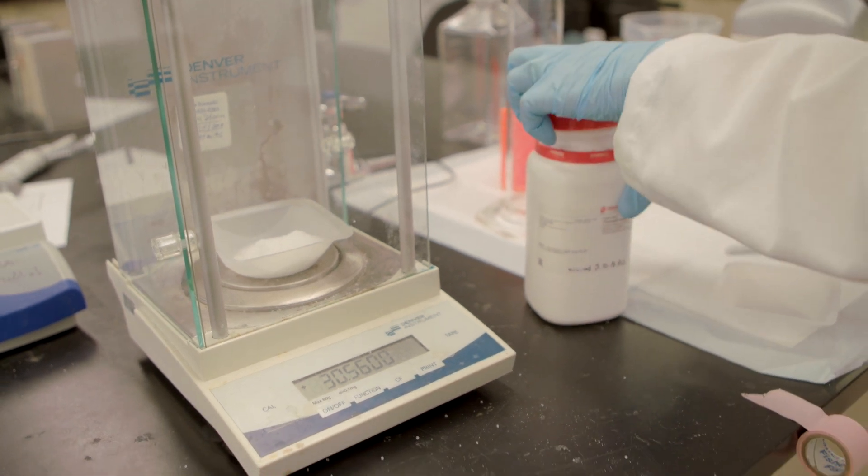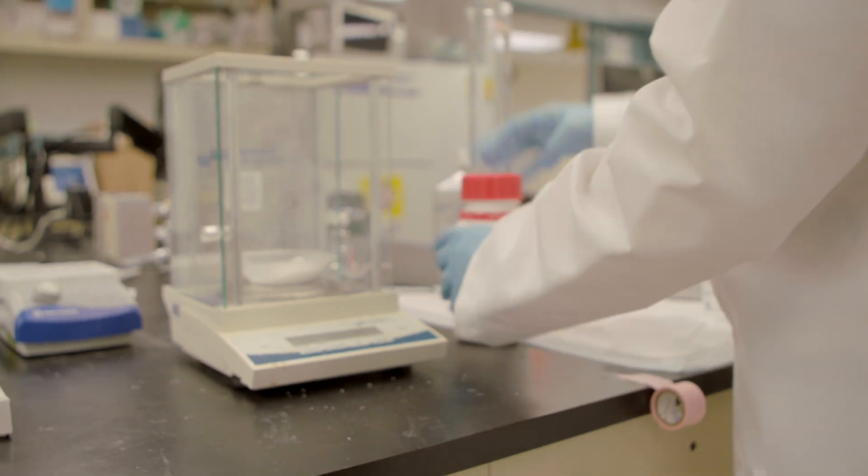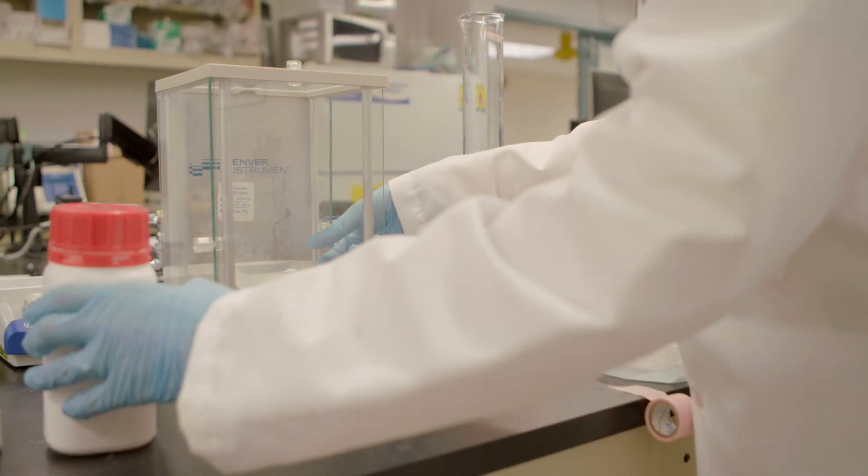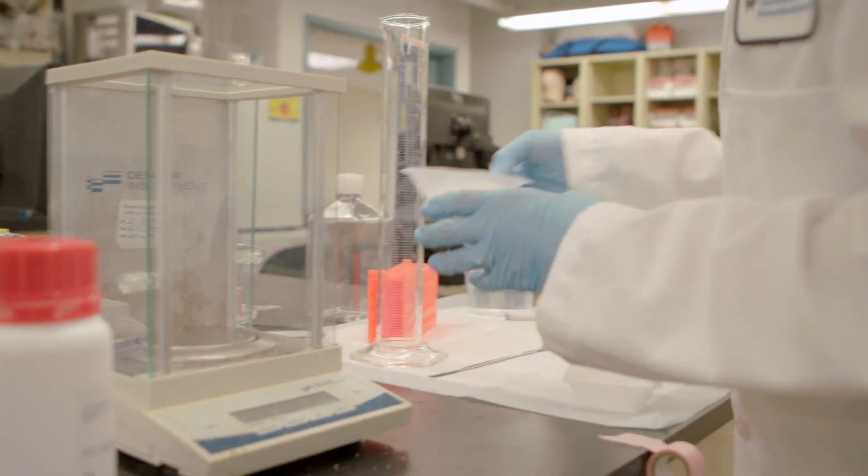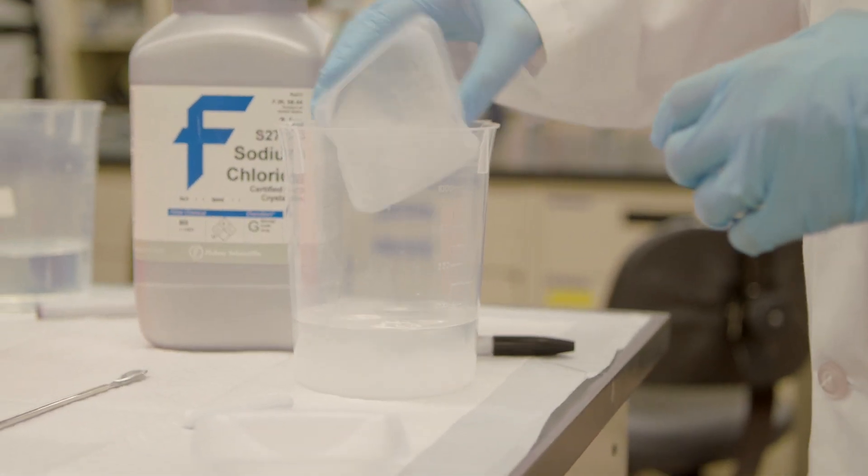Again, being accurate for a larger volume within one-tenth is fine. So I make sure I close up my liquid so I don't spill. I carefully remove my weigh boat and then I'm going to pour this into my solution.